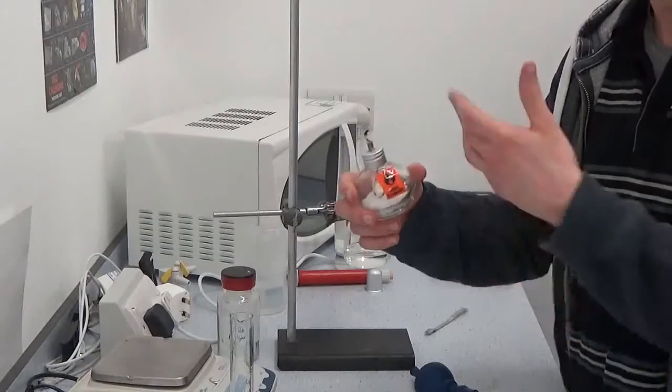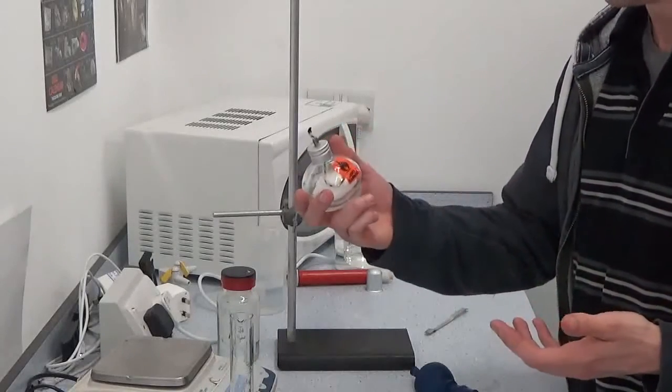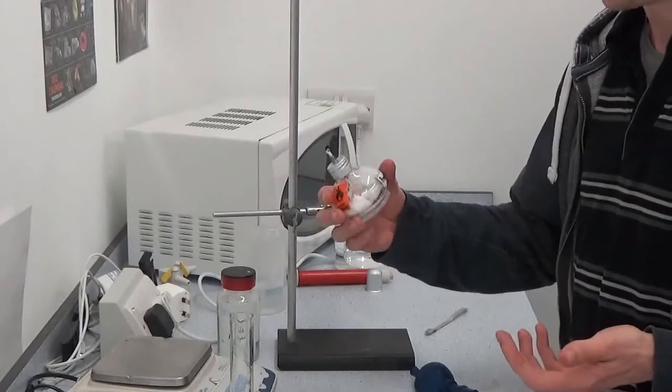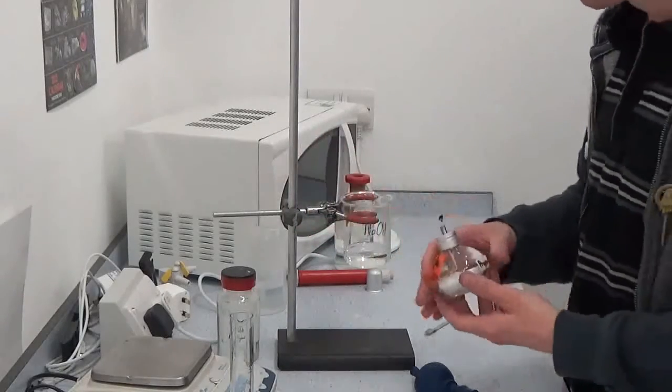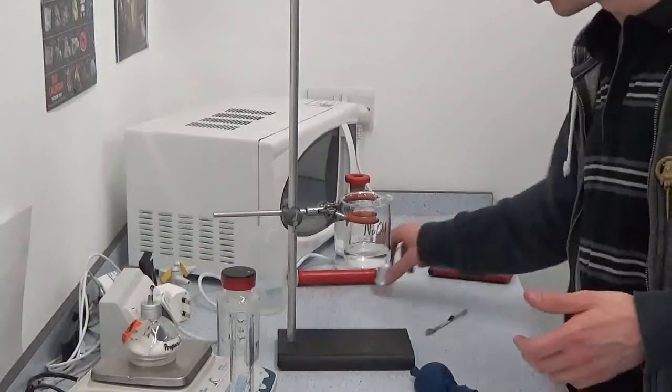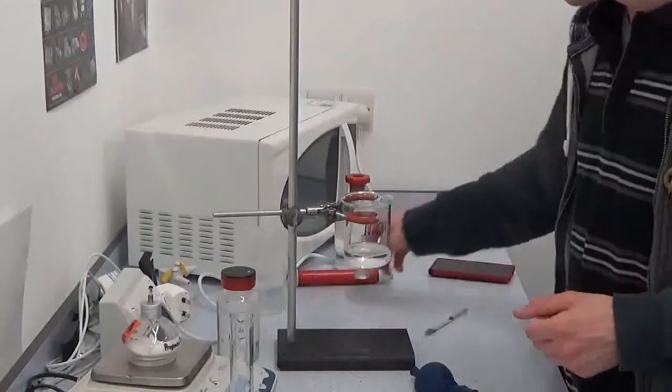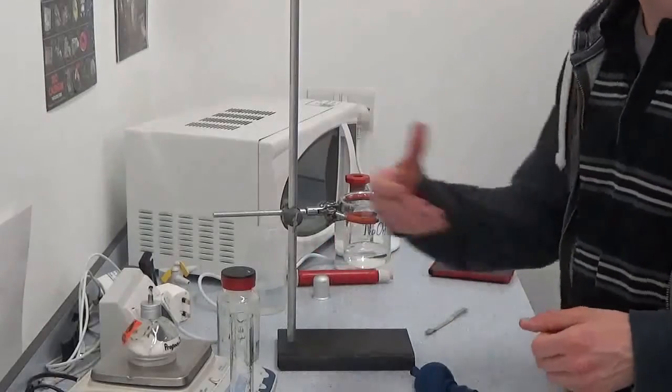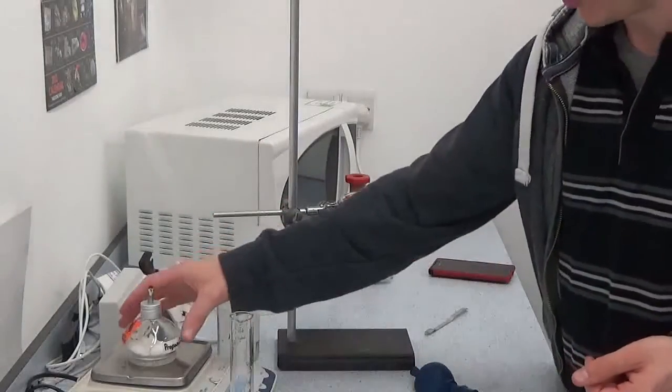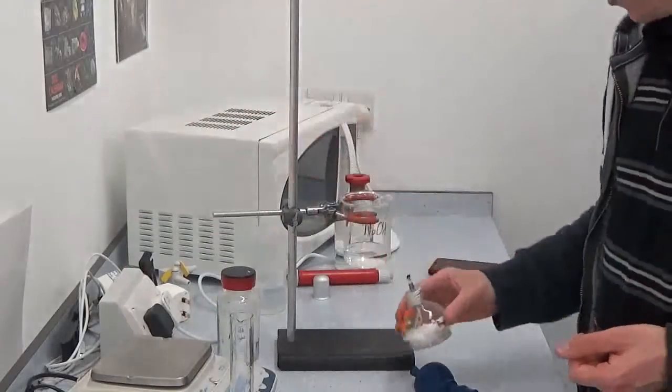We've got our alcohol under here. I'm not going to burn it because I haven't turned the fire alarms off and they're a pain in the butt. They always go off at the slightest thing. So you would record your alcohol there. You can record it with a cap on if you wish. It doesn't make any particular difference as long as you stick with the same one at the end.